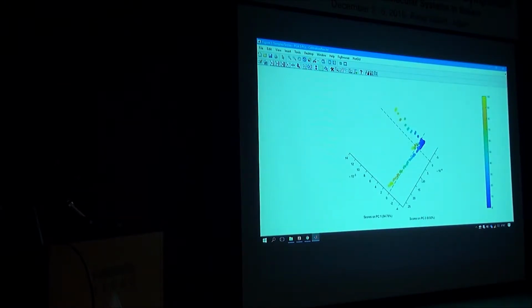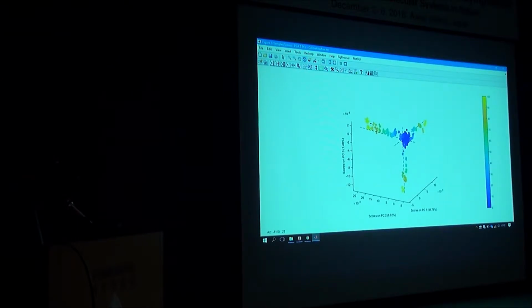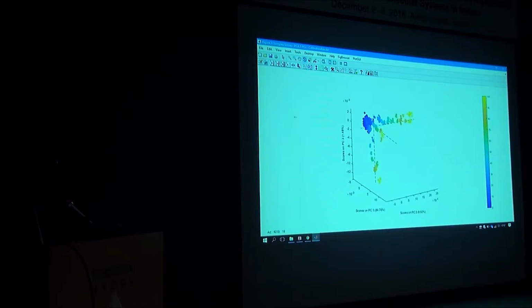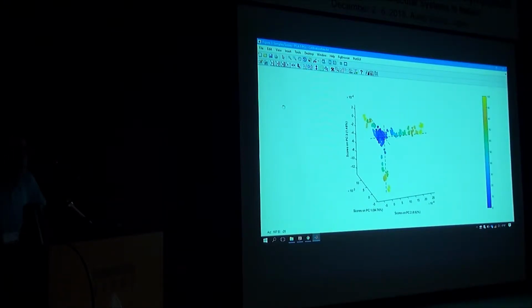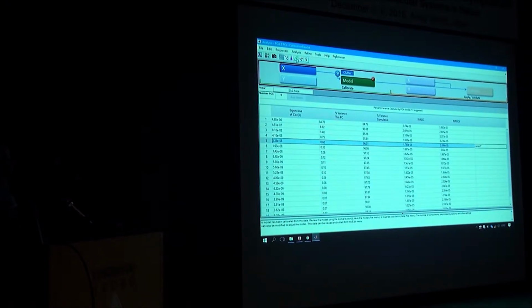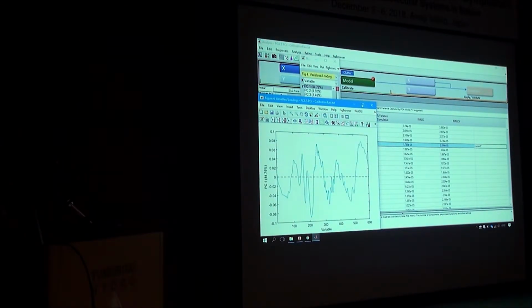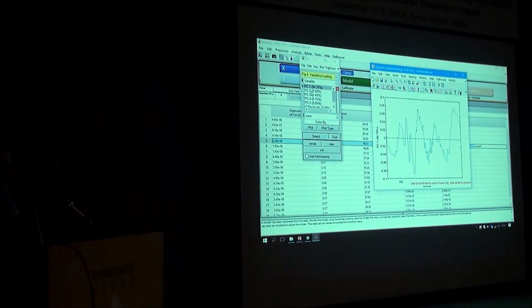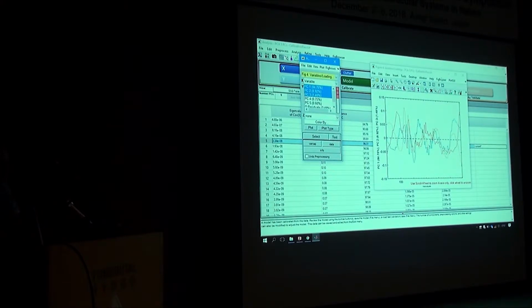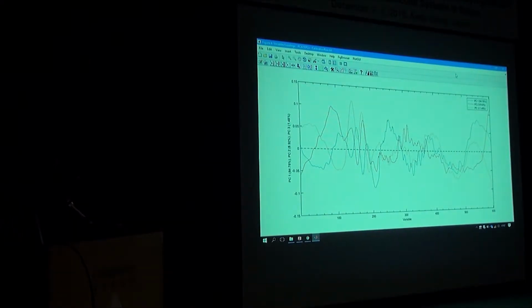On the raw data, there's no spectral subtraction. So we are just subtracting the orthogonal dimensions of the interference from the useful data. And now you can take the loadings. Can you show the loadings? Oh, loadings, yes. This is more meaningful for you. I was trying to avoid that. Why do you try to avoid it? Because I don't know how to interpret them. Yeah. But you know better. So you can have the loading 1, loading 2, loading 3. I think that is good for interpretation now. Interference is gone. Now you can see the real signal. And you could probably focus on understanding what each one is.